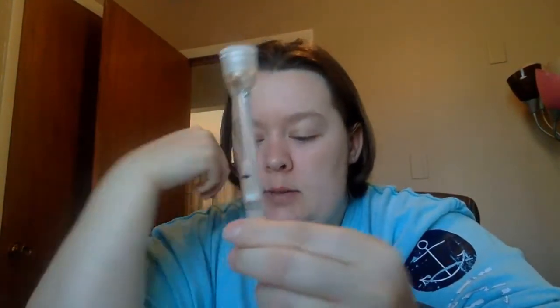In our ion exchange column, we're going to be separating proteins based on charge. Ion exchange is typically used to separate proteins based on their charge by utilizing their isoelectric point. So again, for rafinotoxin, at a pH lower than 7, it's positive, and at a pH higher than 7, it's negative. We're going to use what we know about how it's charged at different pHs to help us separate this into its components by using the pH of the substance that we filter through the column.